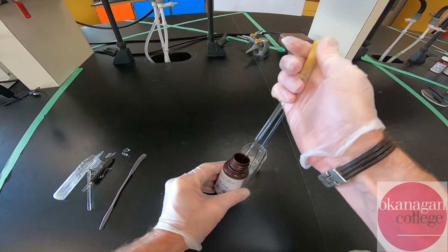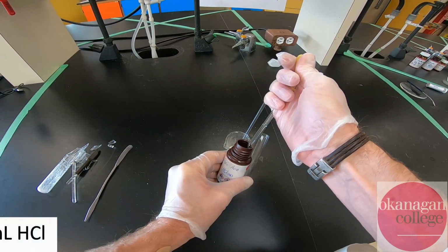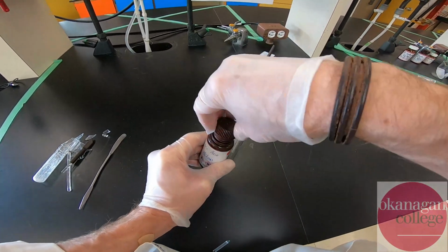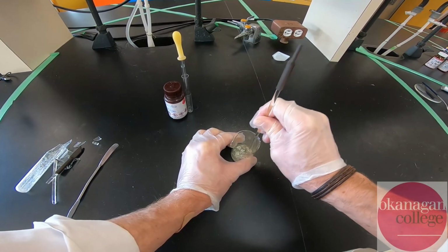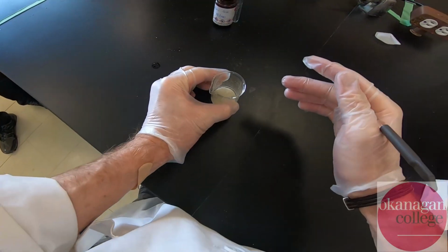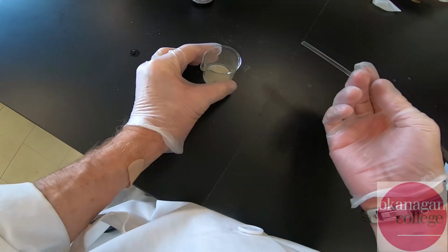And just as a rule of thumb, a full pipette is worth 2 mils. I'm going to actually add approximately 3 mils. Okay. And very gently over the next few minutes, I'm just going to break this material down, giving this reaction a chance to complete.